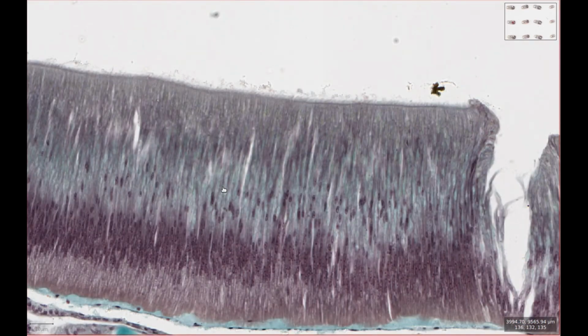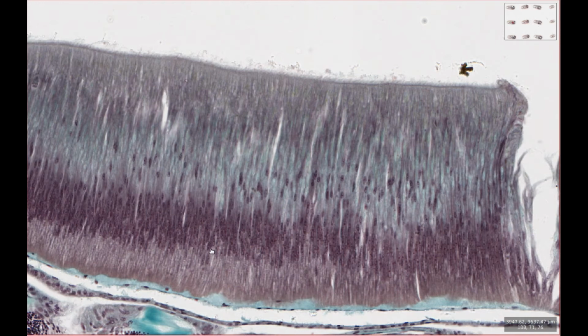So what does this organ do in the Amphioxus? Well, it digests the food particles that are being passed to it, both extracellularly, so secreting enzymes, and also intracellularly, so it has the ability to take large molecules into these cells and then break them down. So as you can see, these cells are very long. They look nothing like the epithelium that you'd see in a mammalian gut, for example. Again, we have a fuzzy border here. These are cilia. And down here we have all of the cell nuclei. So these dark dots.